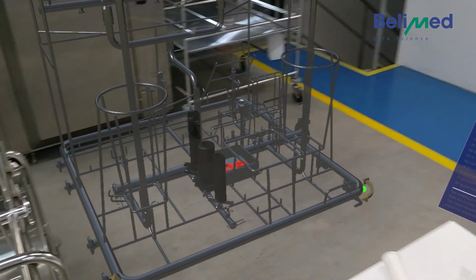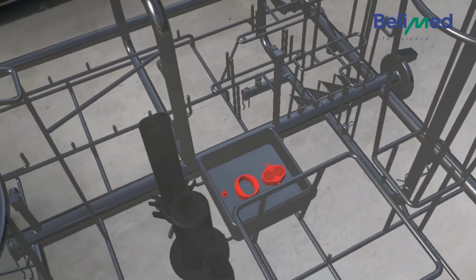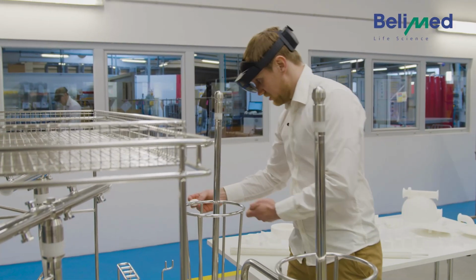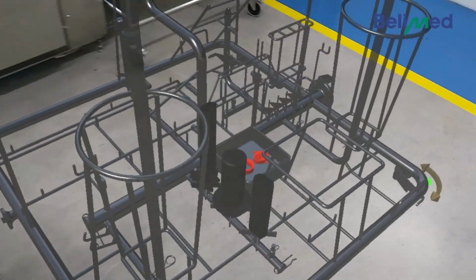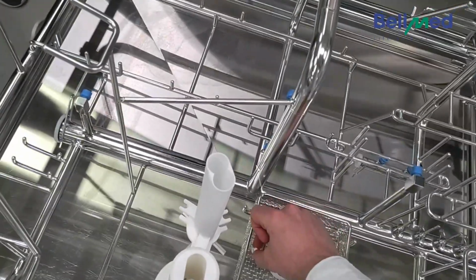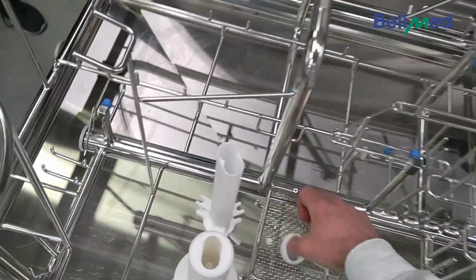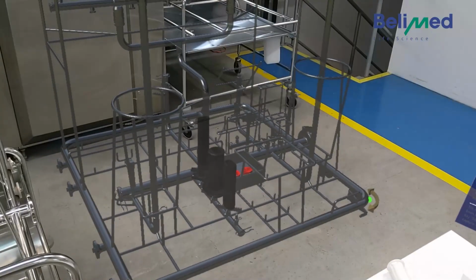So the next parts are within the small basket. It's in total three of them. So the tiny bit, first this one, so here on the right basket, then the round one exactly like this, and then the tiny part exactly next to it, and only one of it. So check.